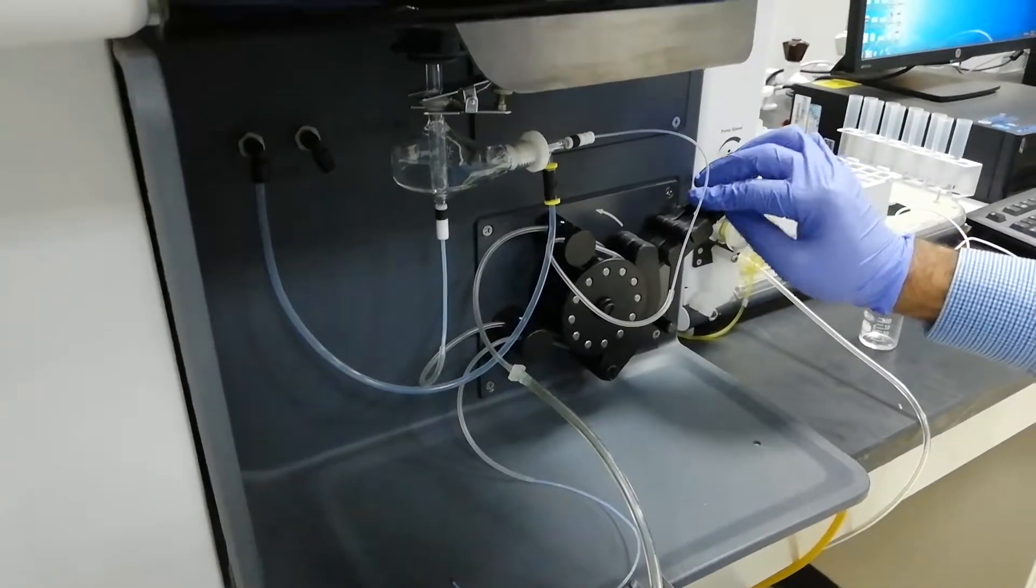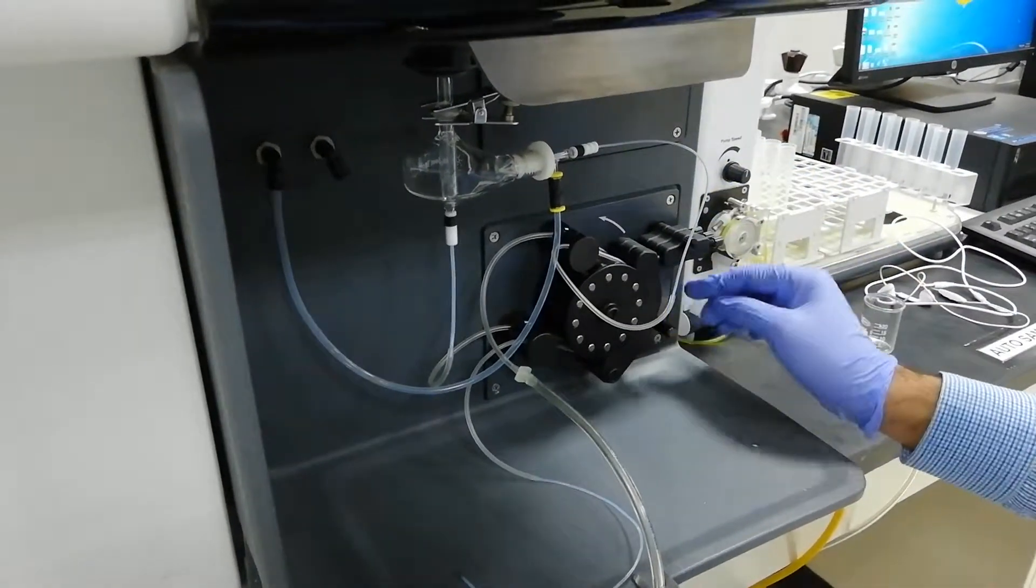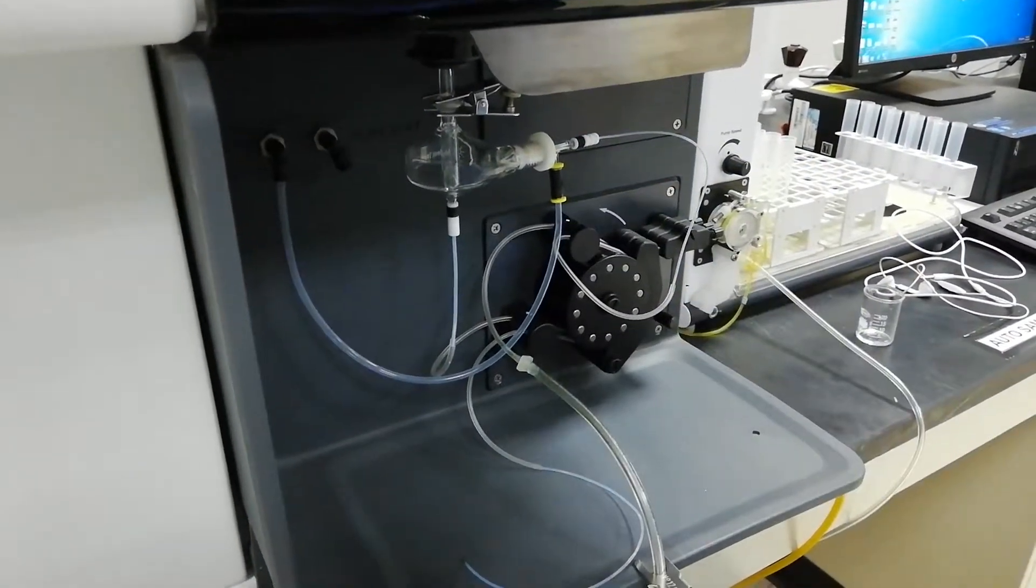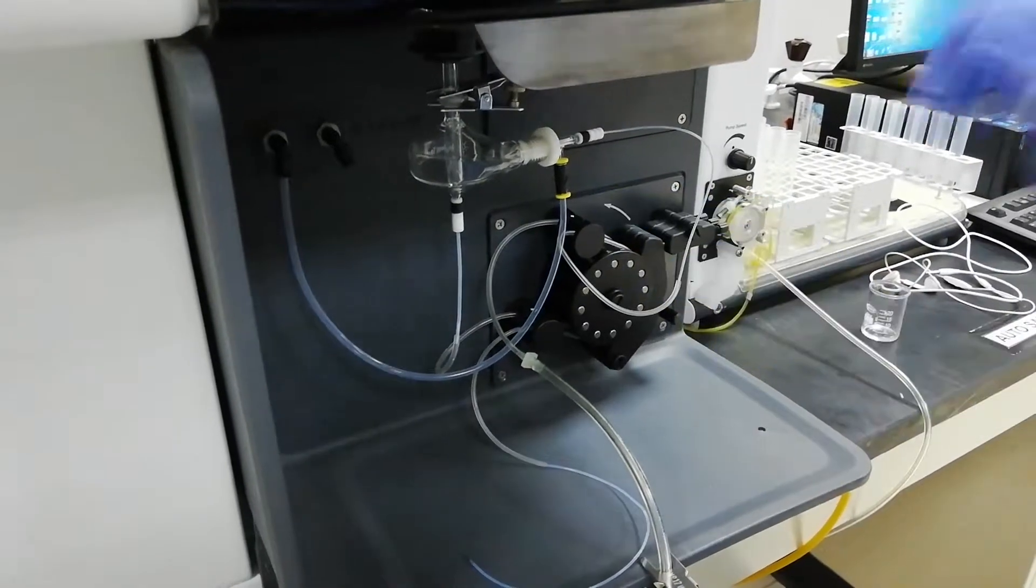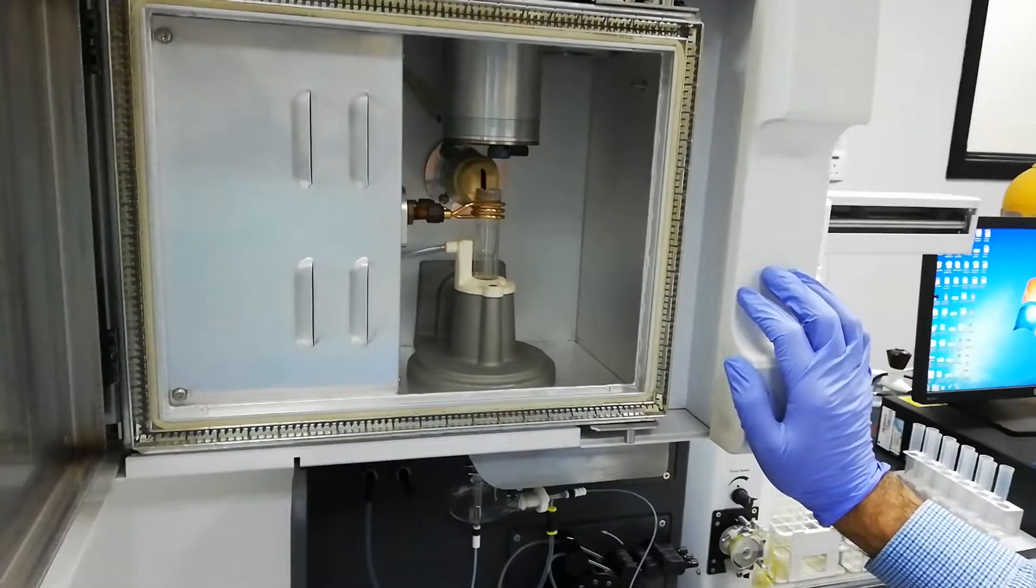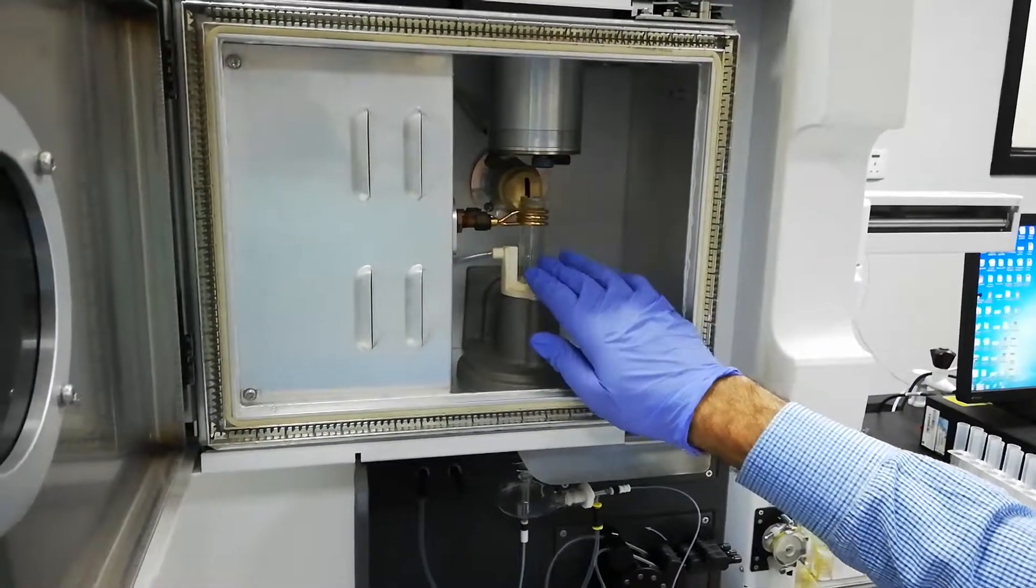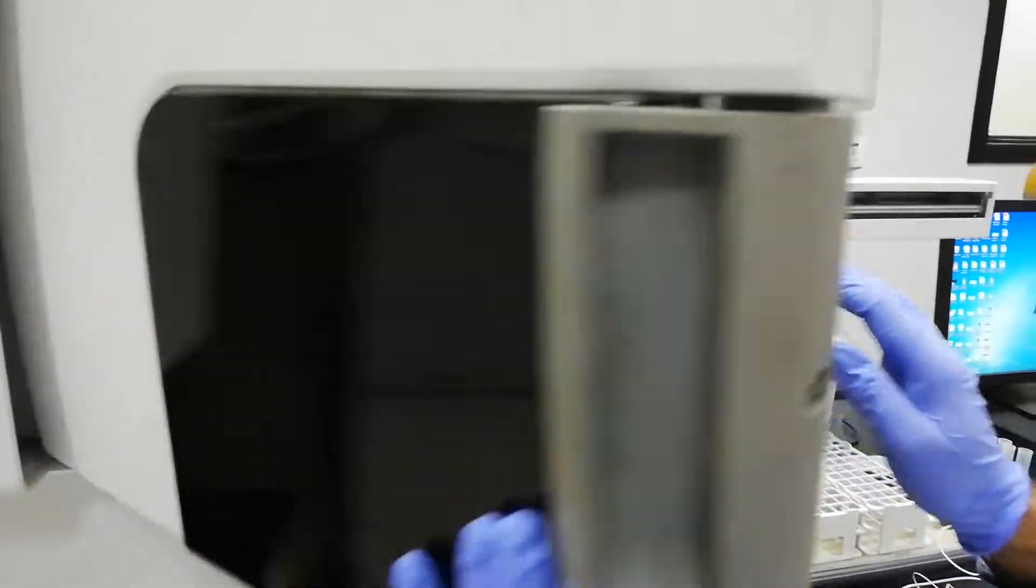So after that, you will put it and then close it. So now, this assembly is prepared for the hardware. You can see here, the plasma door is open. Now it is open and the plasma torch is installed and everything like this.